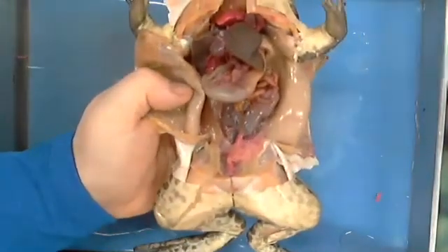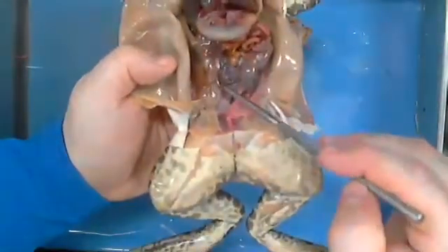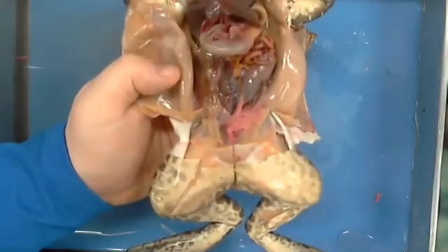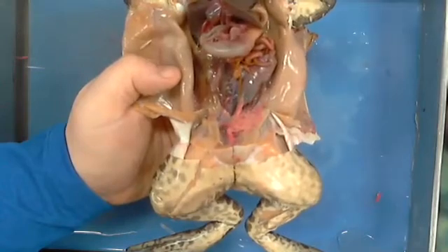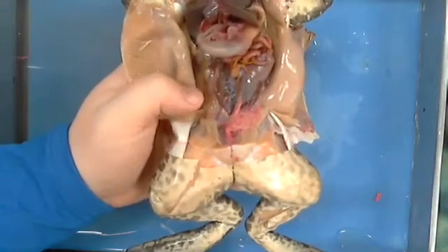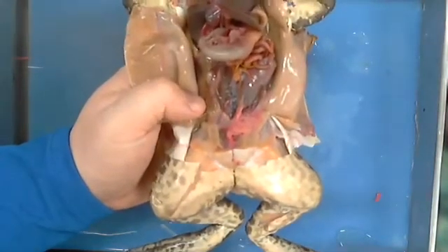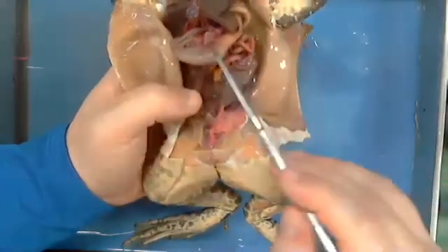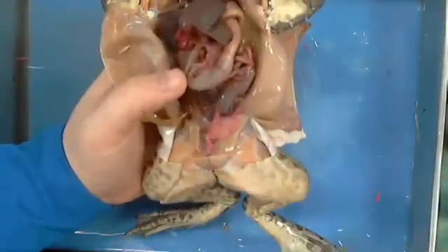Literally, I would ask you this right here. Bella would say kidney. I would say what system? Bella would say what? Urinary. I would say its function. She would say to filter urine and blood, right? Whatever it is. I would then say, what is this big thing? She'd say stomach. I'd ask her what system.